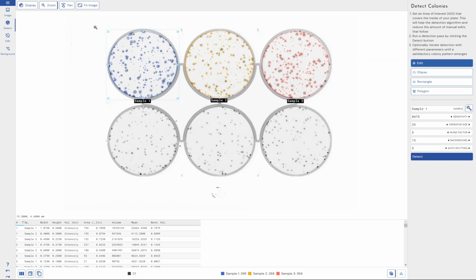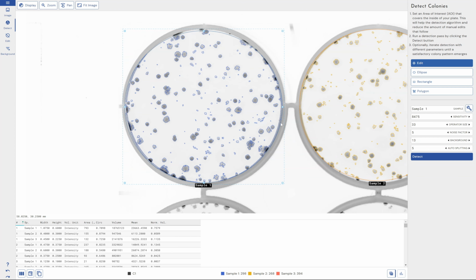Now, I'm not going to extensively run through the optimization of the sensitivity tools on this particular video, because I'm not sure it would be particularly interesting to watch. But what you can do is just click on them and move your mouse left and right, and then hit detect and see how that changes your detection. So I changed the settings there, you can change the operator size. This is obviously going to have to be fine-tuned for your own experiment.